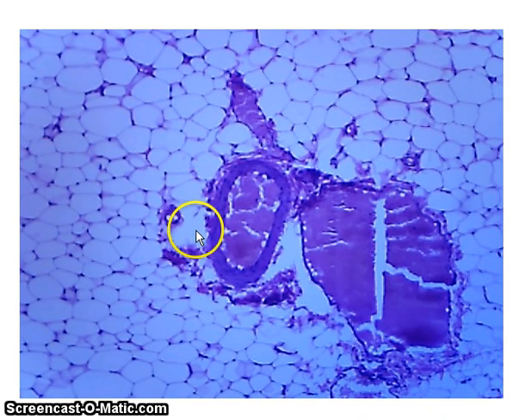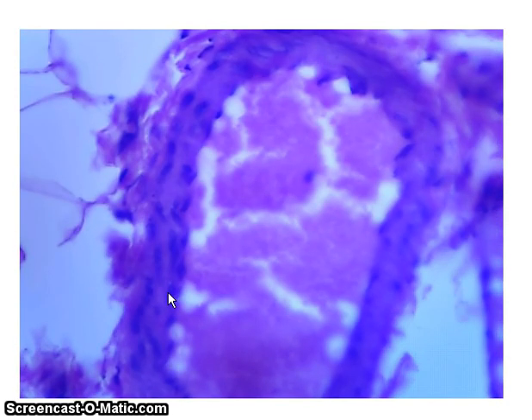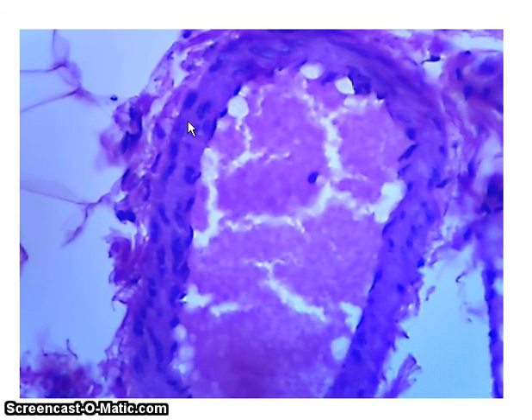Next we have blood vessels in this tissue, and you can see I've got a blood vessel right here. This is a transverse cross-section of a blood vessel. So let me go up again in power and see if we can get a better look at this thing. So here we are, you can see the outline of the blood vessel right here, and you can see some remnants of blood that was inside. And so this is our adipose tissue.